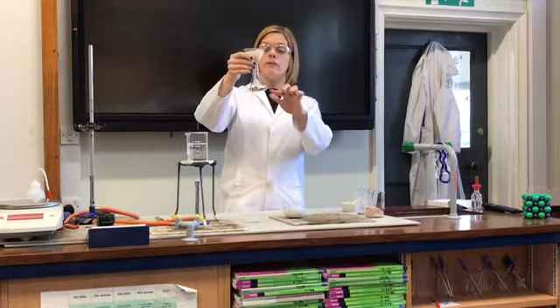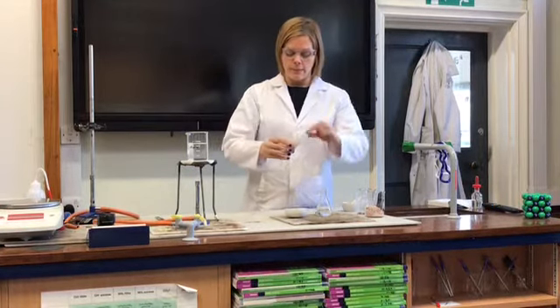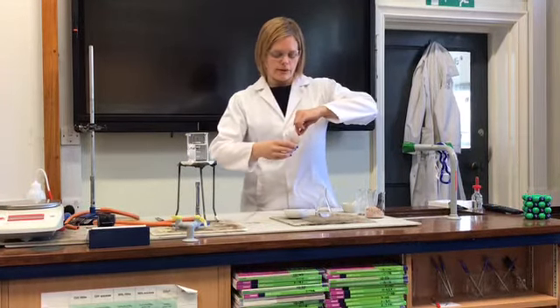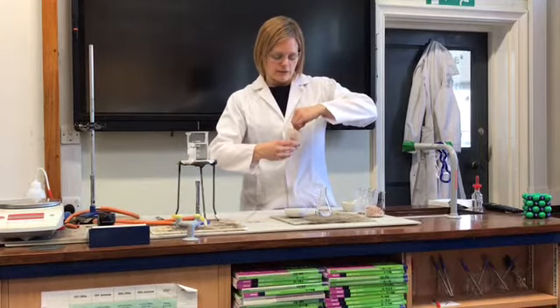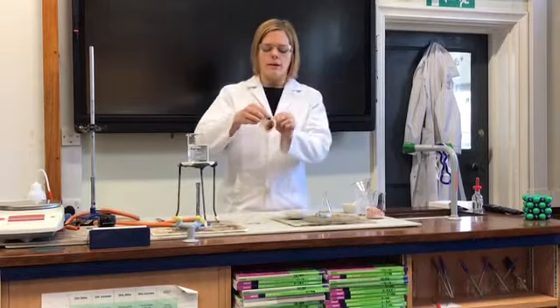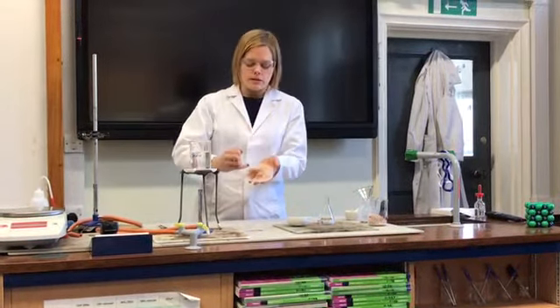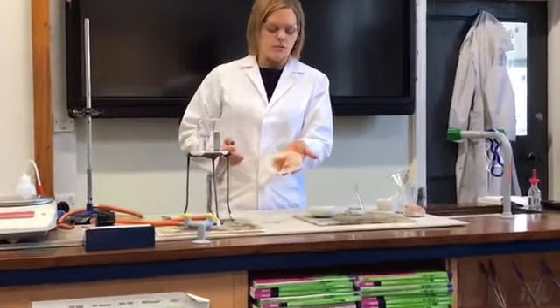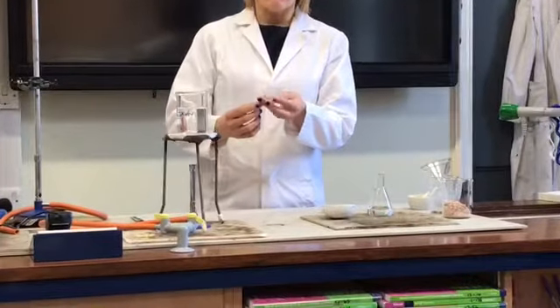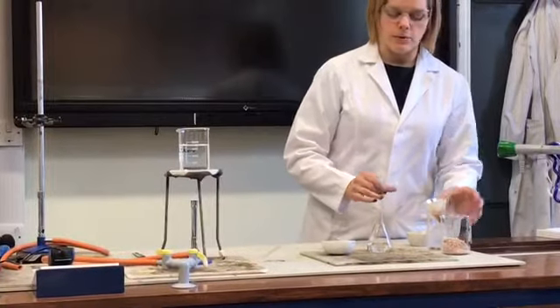So inside the flask is the filtrate—perhaps label that on the diagram you've just drawn. And inside the filter paper, if I just carefully lift this out with my fingers, I know that's safe to do because it's just salt and water, we've got what's called the residue. This is the remainder of the insoluble components of that rock salt. So that would need to be disposed of, so I shall pop that back in for disposal later.